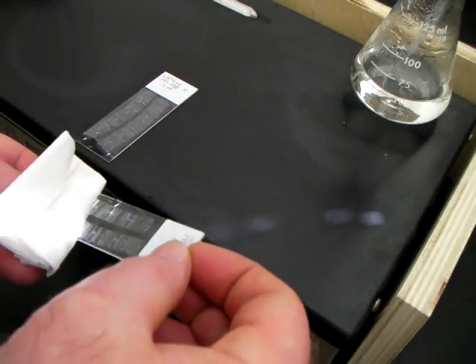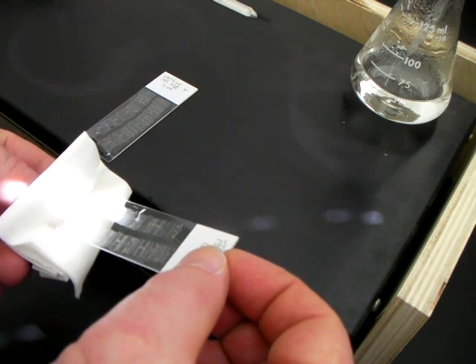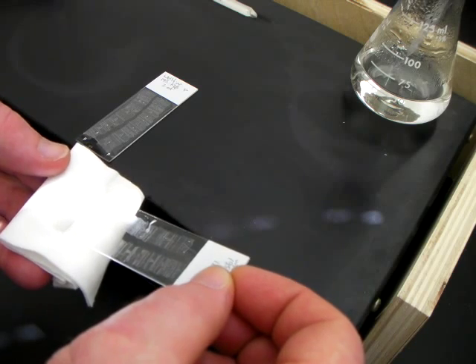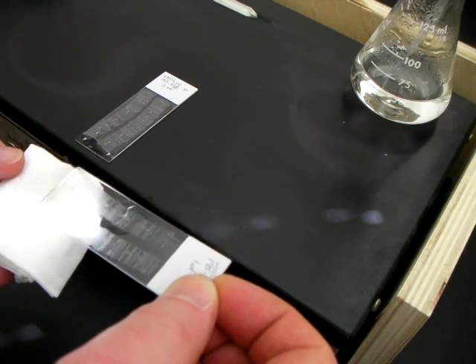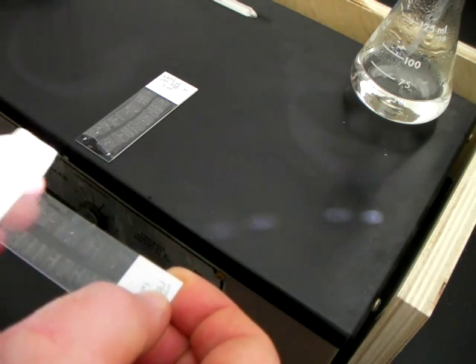Go ahead and pull this off of here now, and I'm just going to tilt it ever so slightly down towards the chem wipe. It's not necessary to get all of the water off. Go ahead and give the bottom a bit of a wipe.